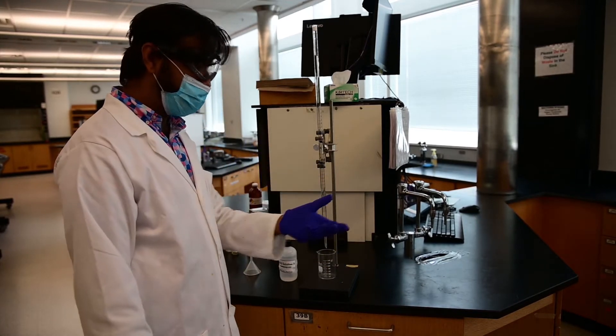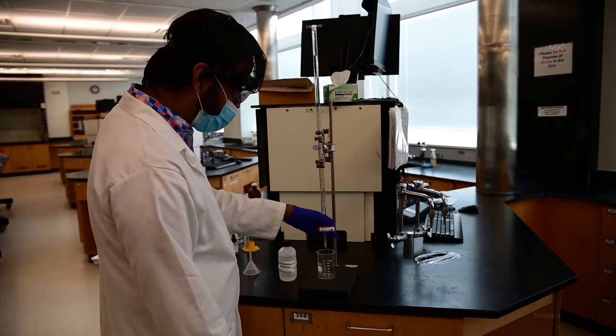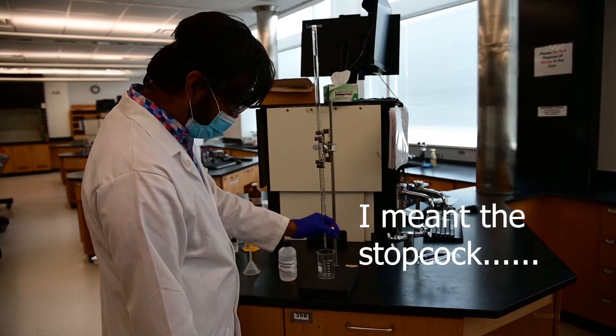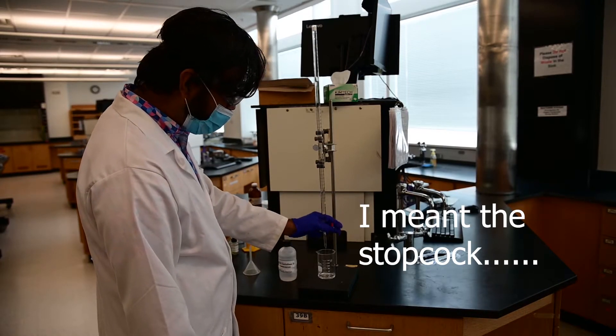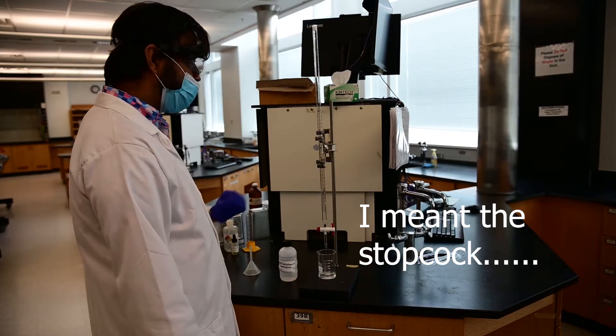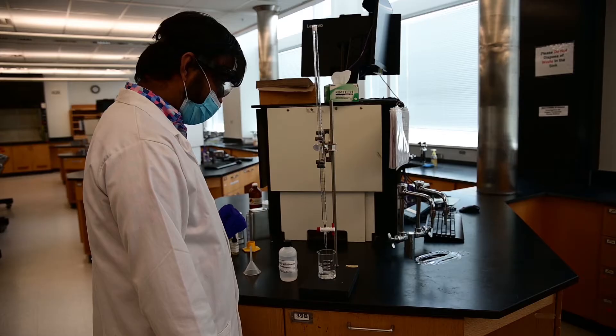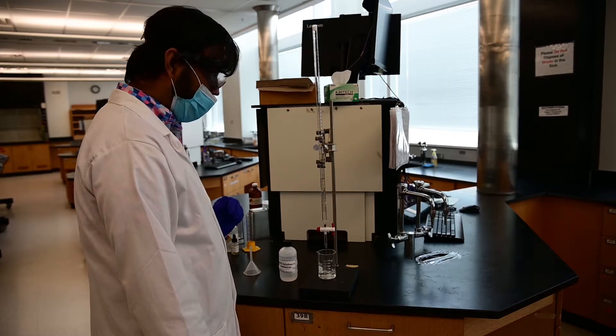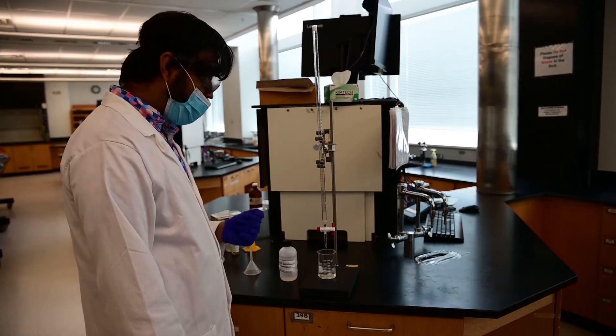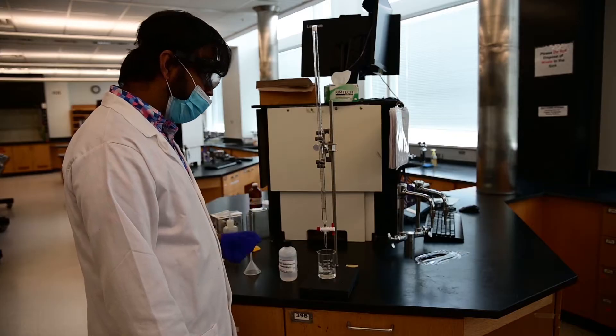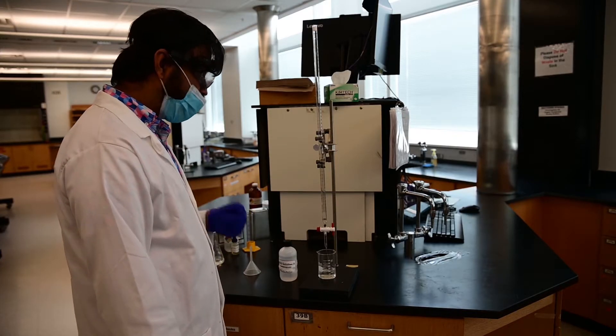I always use my non-dominant hand, which is my left hand, to open the tap. And open it completely to drain the water inside the burette completely. Always know when you are coming in, the liquid in your burette is water and you have to drain it out.